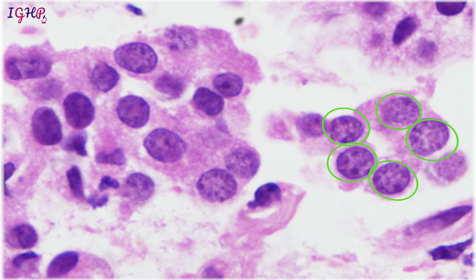Now the third type of cytoplasm, like we see here, is again a moderate amount of cytoplasm. It is eosinophilic, finely granular, and moderate in amount. It is ill defined, you cannot make out the cell boundaries. When we see this kind of cytoplasm, we are talking of some granularity, and most likely we are talking of some hormonal changes, or cells which belong to the endocrine organs. In all epithelial cells which form hormones, you see some indistinct eosinophilic granular cytoplasm. So in cases of medullary carcinomas of the thyroid, neuroendocrine carcinomas, and pheochromocytomas, you will see cytoplasm like this.